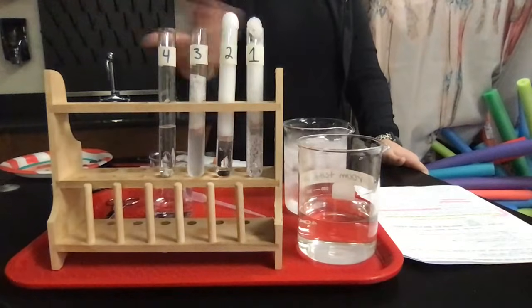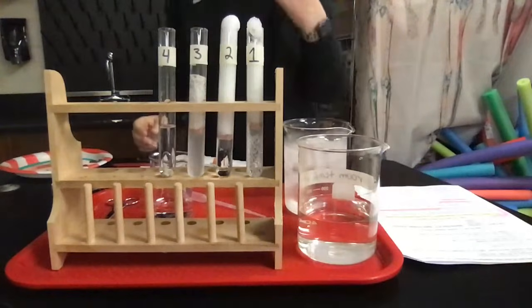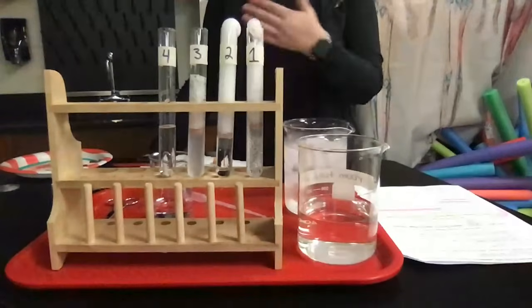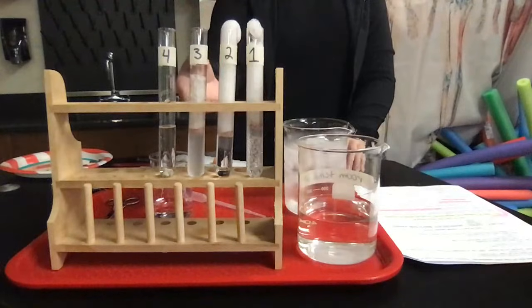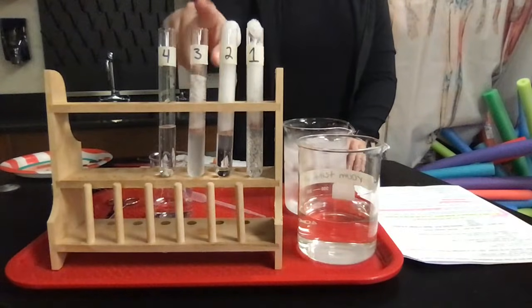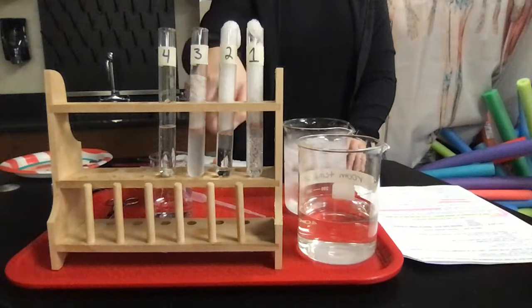Now, water does have a high specific heat, and because hydrogen peroxide contains water, it does have a high specific heat as well, which means it resists changes in temperature. But because these reactions are proceeding, they're creating heat, which is going to raise the overall temperature, which pushes it closer to a physiological temperature. Now, obviously, it's still a cold environment, which is why it's not reacting as well. But you just saw a few seconds ago that number 2, which was the room temperature, really started taking off.